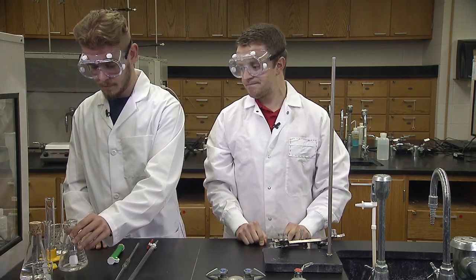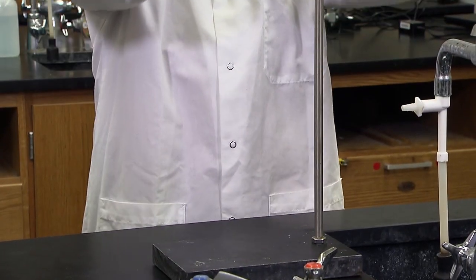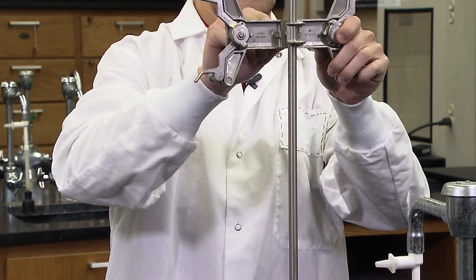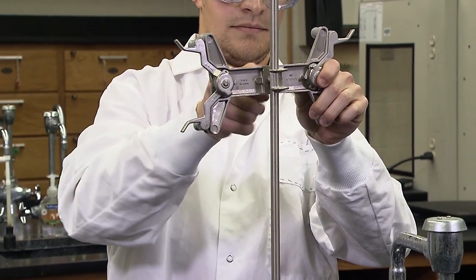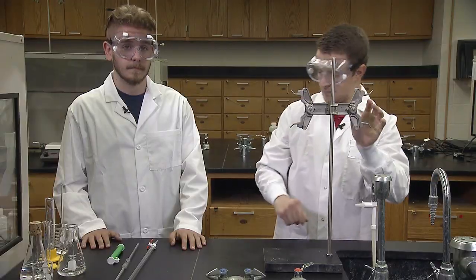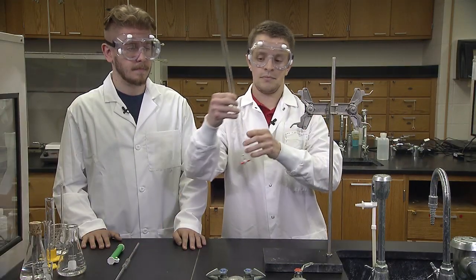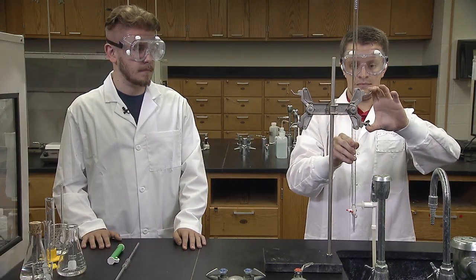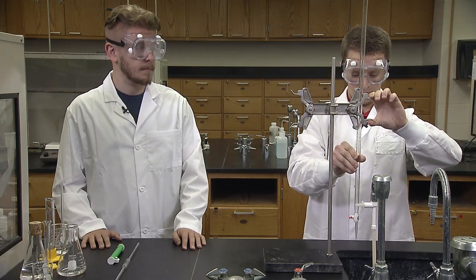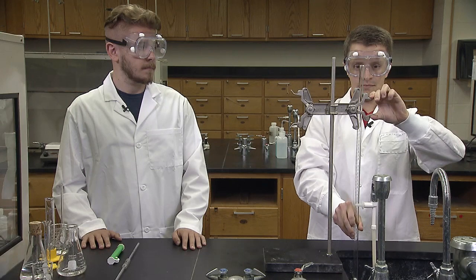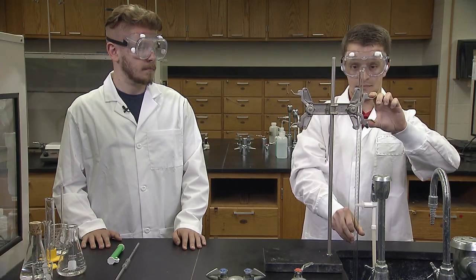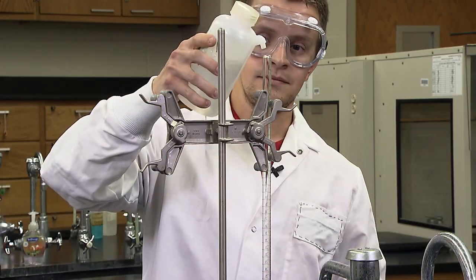The burette is cleaned with water, just like the pipette.